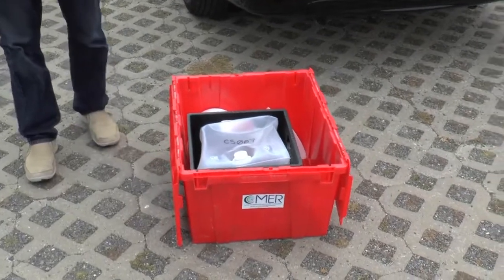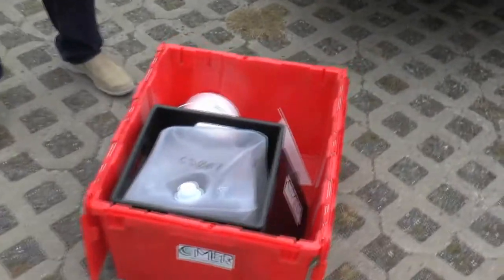Clipboard, funnel, bucket — we're good to go. A recent example would be Chernobyl, 28 years ago. It was both cesium-134 and cesium-137. So you have two isotopes, one element — cesium — so it behaves exactly the same in the ocean. It's soluble, it moves with the currents. One part of that is disappearing faster than the other, and so that's why I call it a fingerprint. I can tell uniquely where it's from based upon how much of these two isotopes are in the five-gallon sample we collect today.